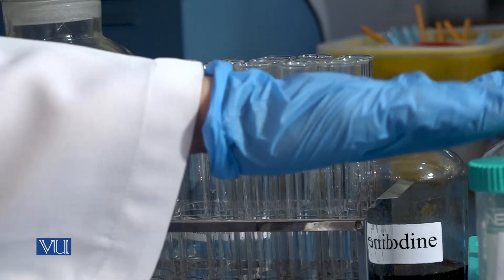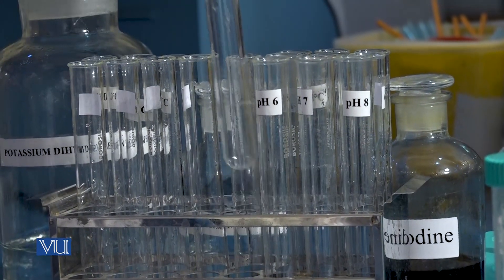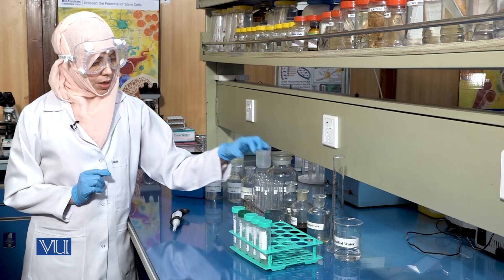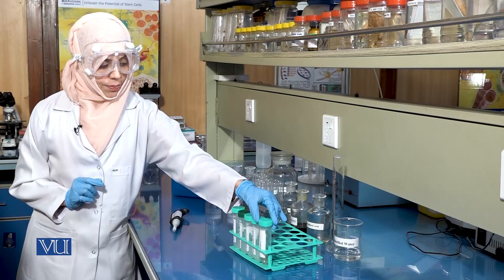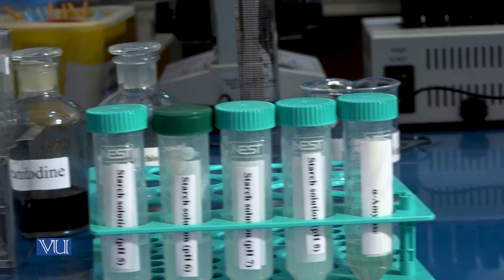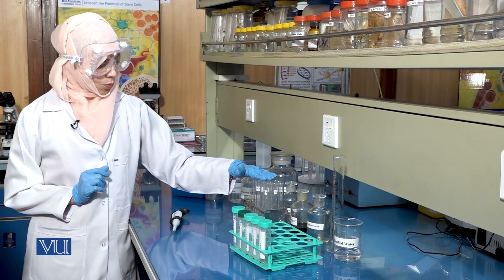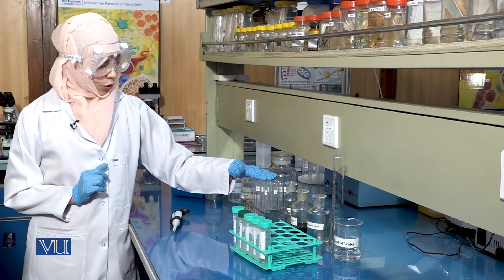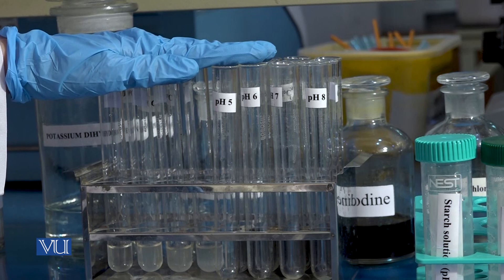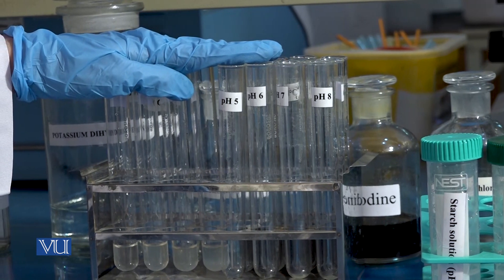We will take 2 ml of each starch solution in a labelled test tube and add 1 ml of the enzyme, that is alpha amylase, to it. We will then cover the mouth of the test tube with aluminium foil and place it in an incubator at 37 degrees centigrade for 10 minutes.